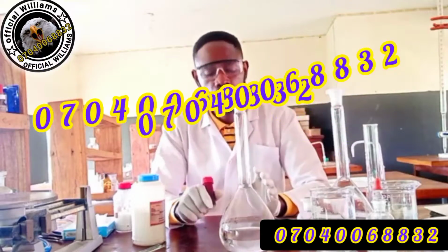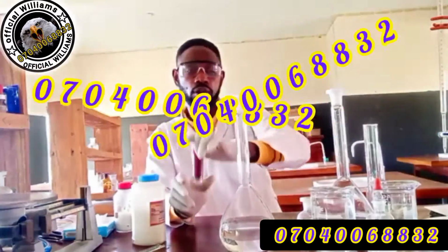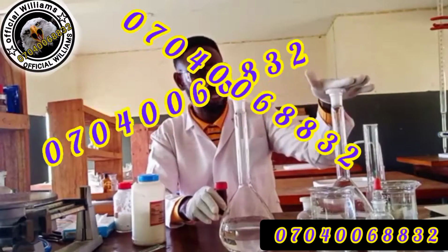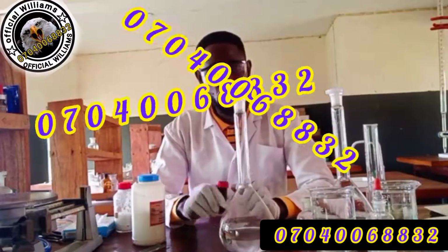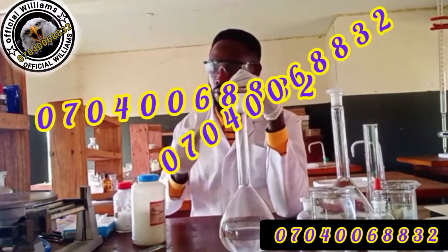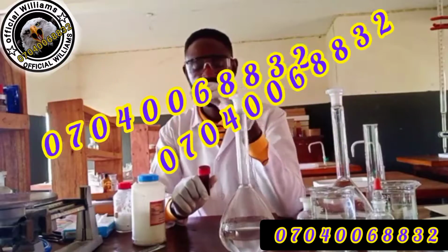So I'm trying to show these things. That's why I'm kind of wasting this iodine already, because I know I won't be using it any time from now. And keep this tight after preparation, both the A and the B, and keep it away from your students. Now, what did I say we do? We add the iodine crystal. I've measured this already. Remember, you have to measure according to the instructions.